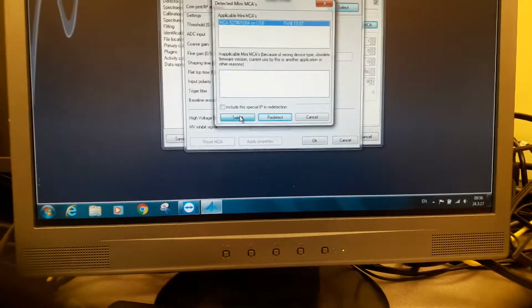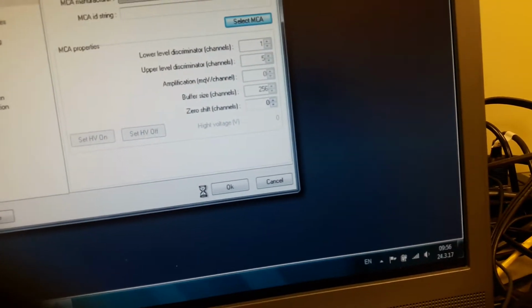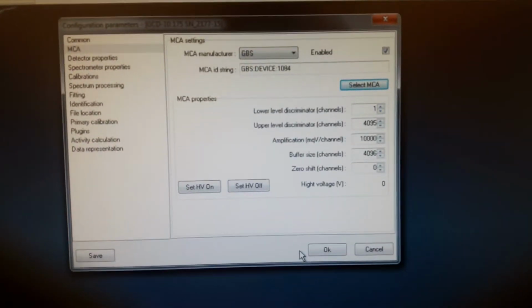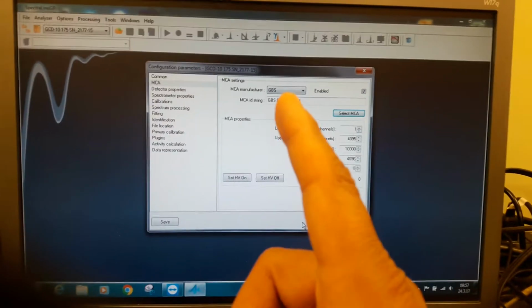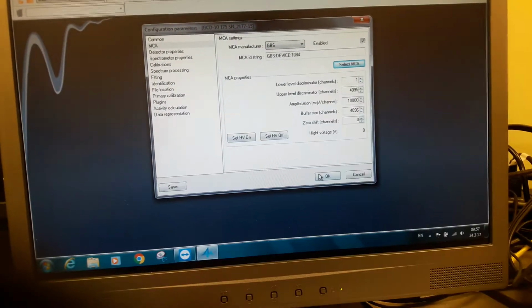So we can select this MCA, and the parameters that were actually saved in the MCA from the WinSpec software are going to be loaded. We can just OK out. And now we know that we have discovered the MCA, but we emphasize the sequence: the MCA must be in the off position when you open the software, and you must turn on the MCA after the software is turned on. Okay, so this is the test that we wanted to show you.